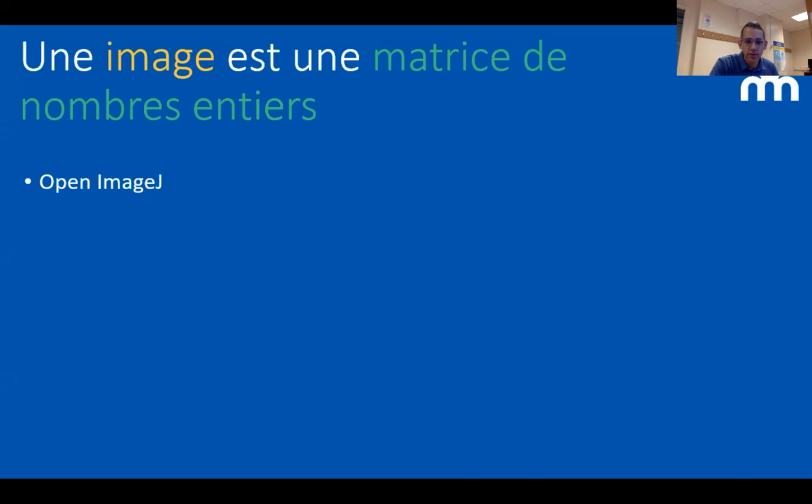No, it's not at the top of the chat. The link is going to be sent. It's there again. I put the link again, install it, and we will actually open it. And I'm going to show you what it looks like.